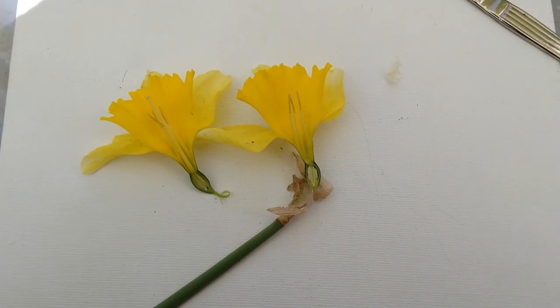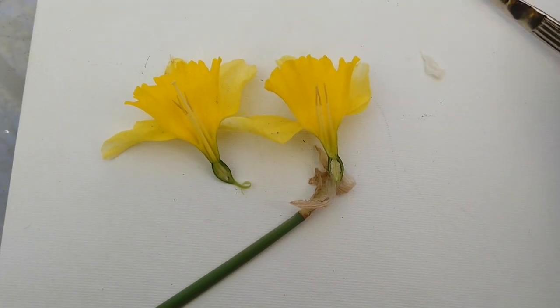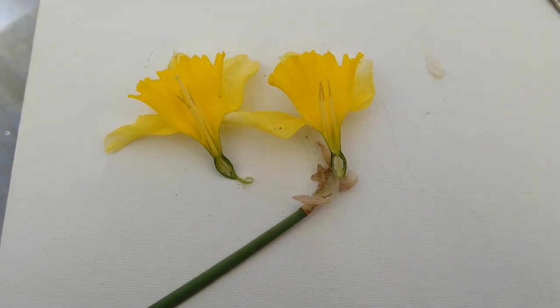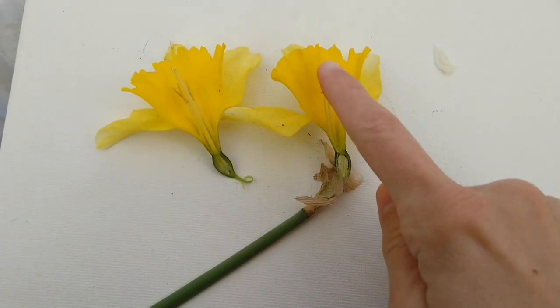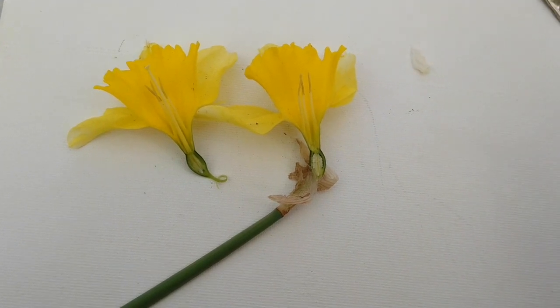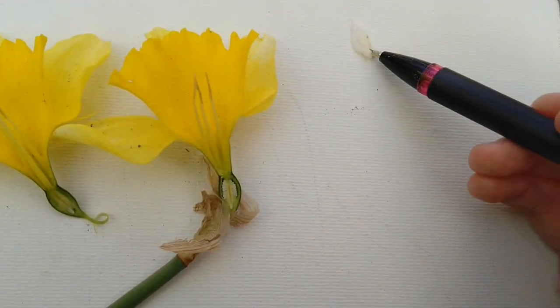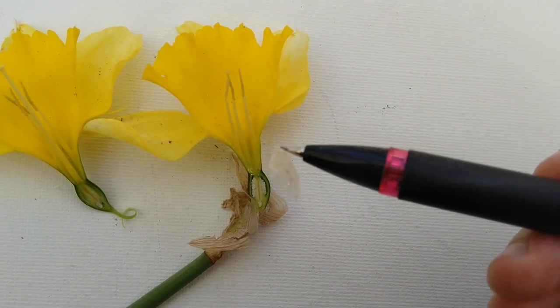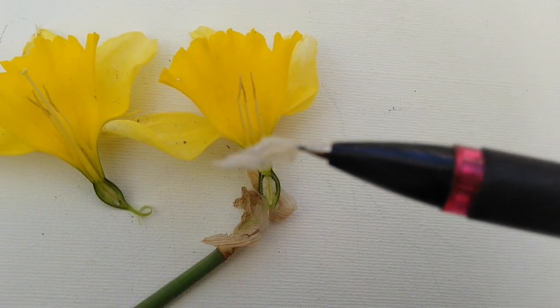Alright, so I used my handy dandy sharp knife to cut open this flower, and you can see I cut it in half so that we can see things a little bit closer. Over here, by the way, this is the little bit of spider web that our spider friend was living in, so maybe you can see it a little bit better.